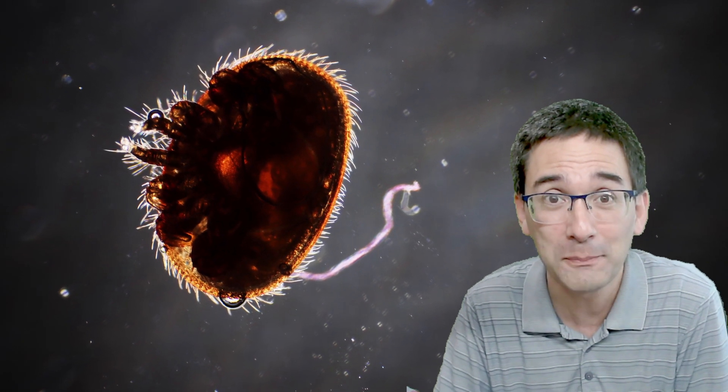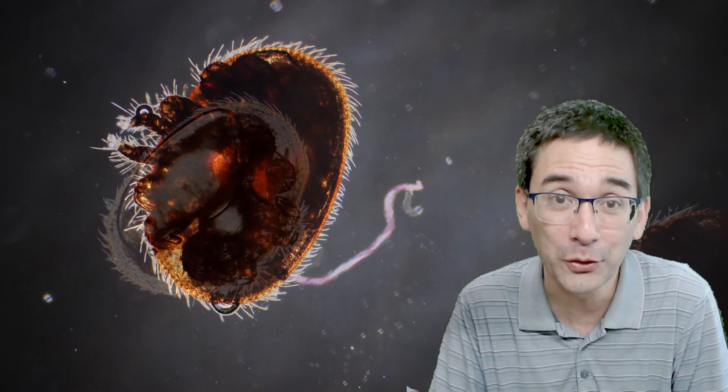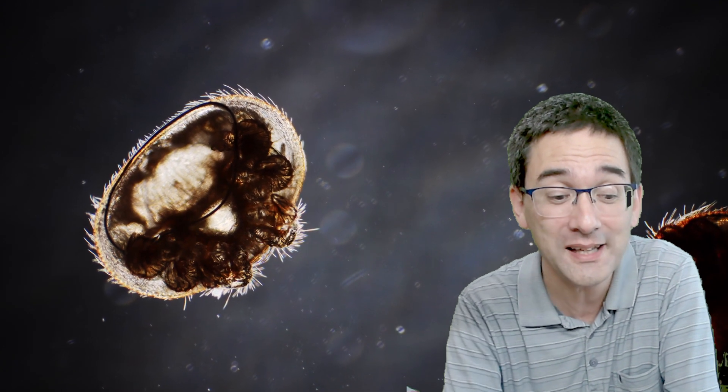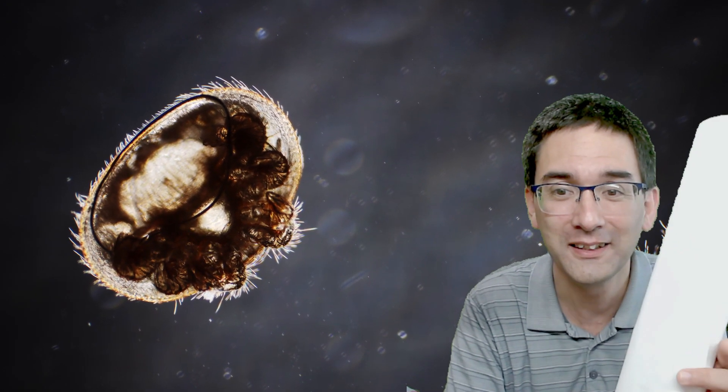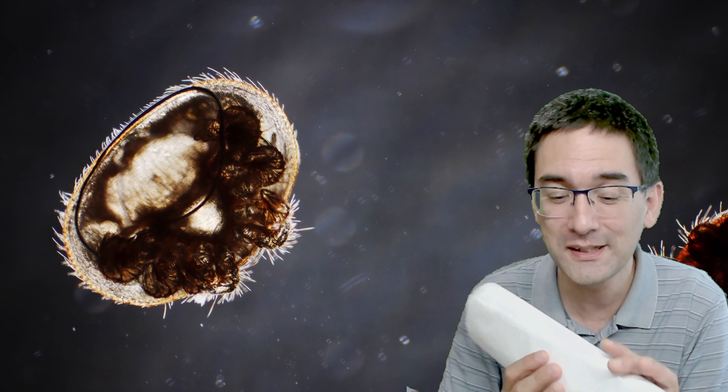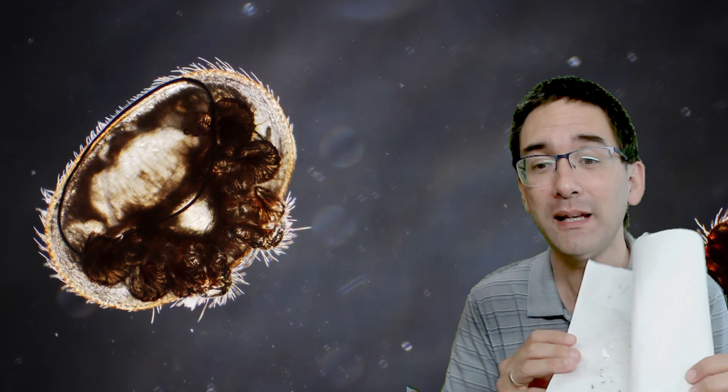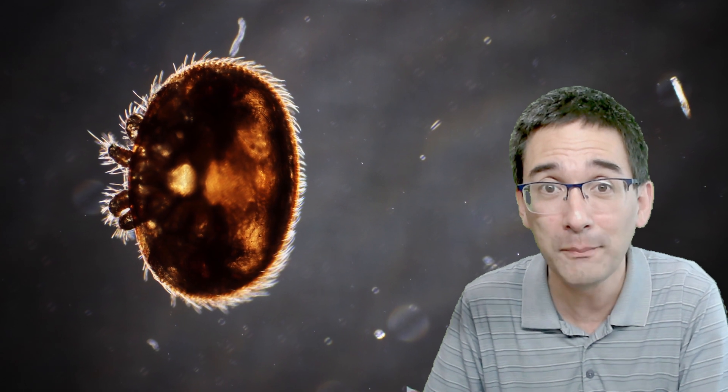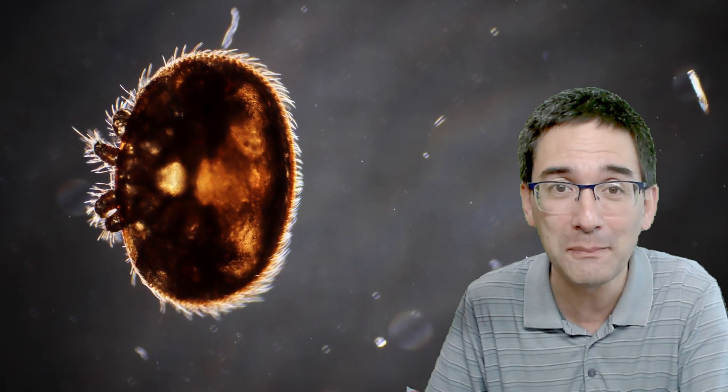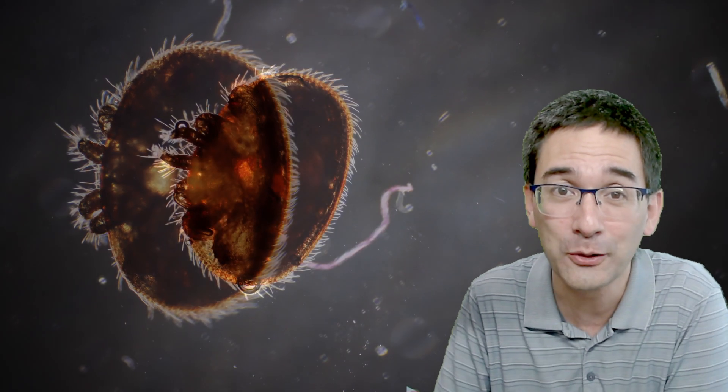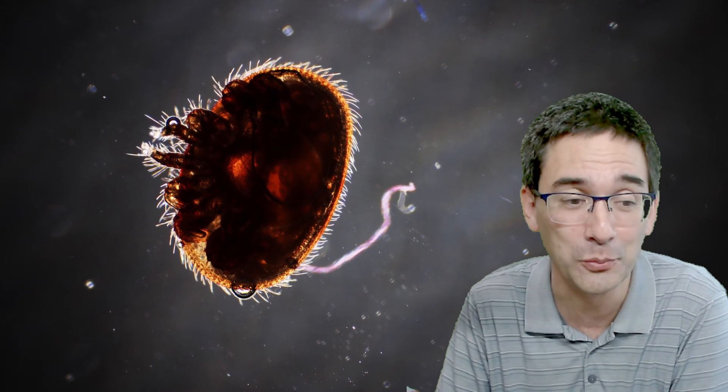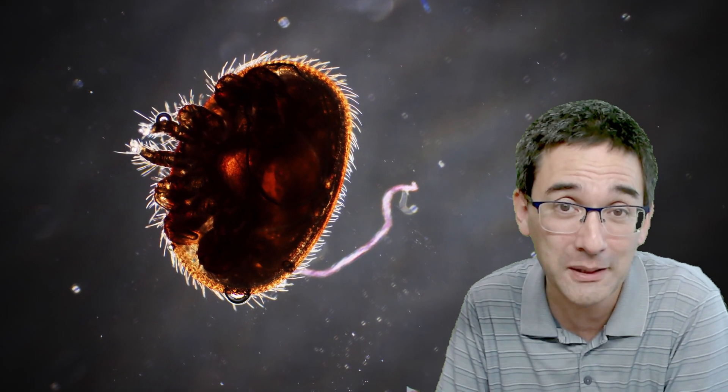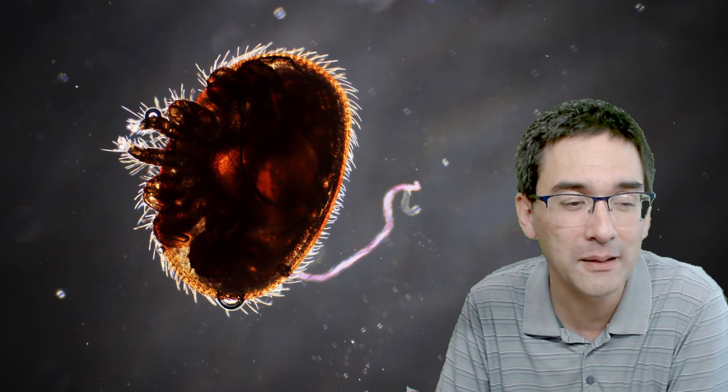This is of course a problem for beekeepers. I got these mites from a student as a present. Look at this sheet of paper here - it contains many of those mites. In this video I'd like to show you how the mites found their way onto this paper, how I collected them, and how I made microscope slides. Of course I'd like to talk about why those mites are a problem.